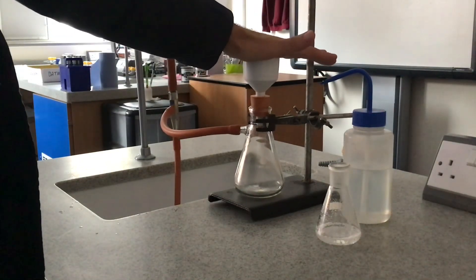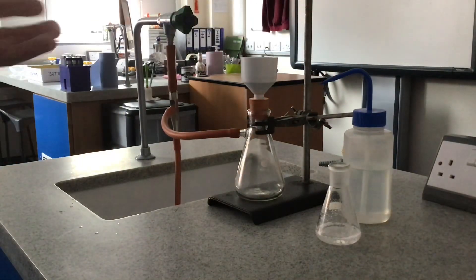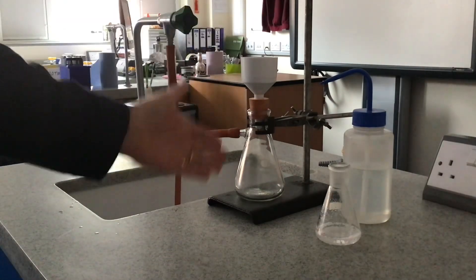If I keep it on, you see I can lift up the retort stand. It's that powerful, the suction. The air is well and truly being drawn through that funnel.